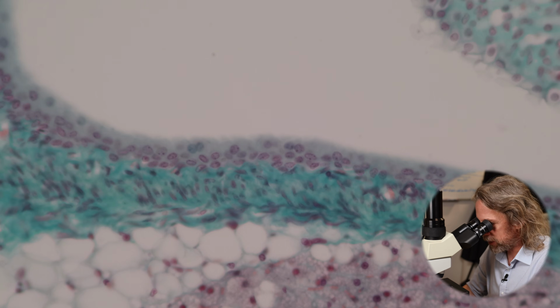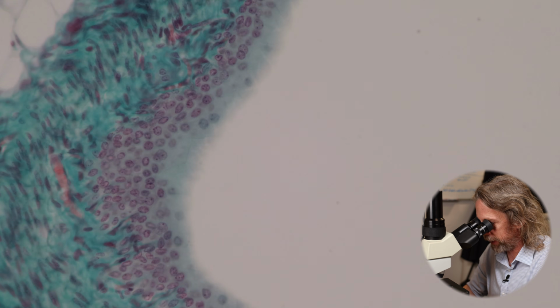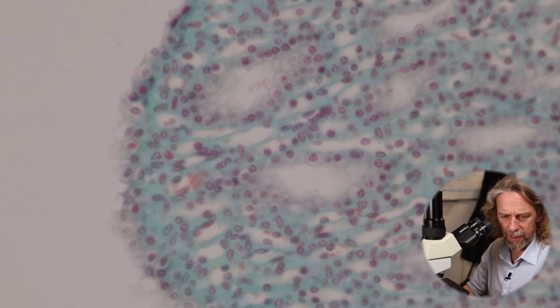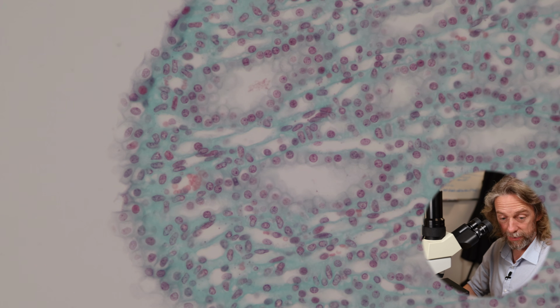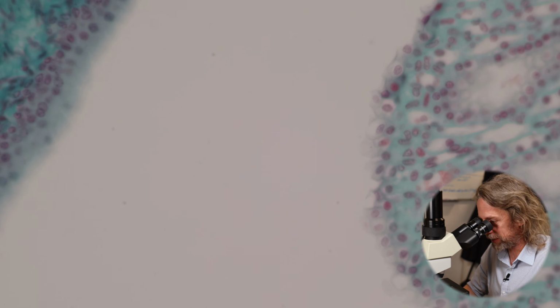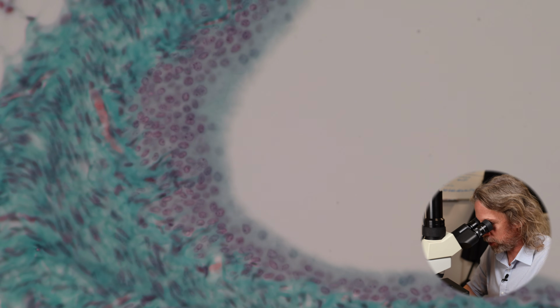And it's special and interesting for a number of reasons, which I'll talk about later, and I guess next week we'll look at the bladder. But if that side there is the medulla, that's where the urine's coming out through all those ducts, and it's collecting into that space there. This side here, this is where we find the urothelium.